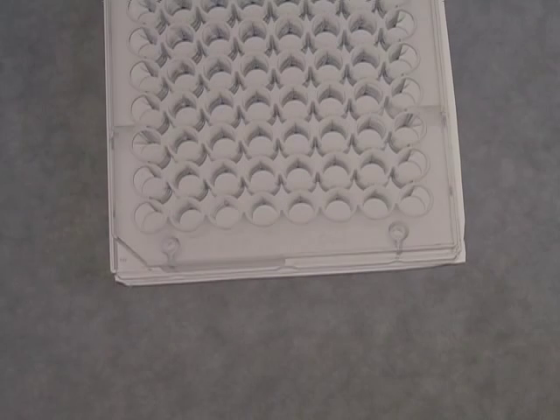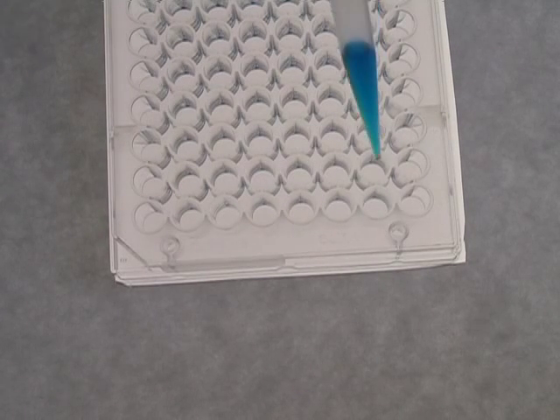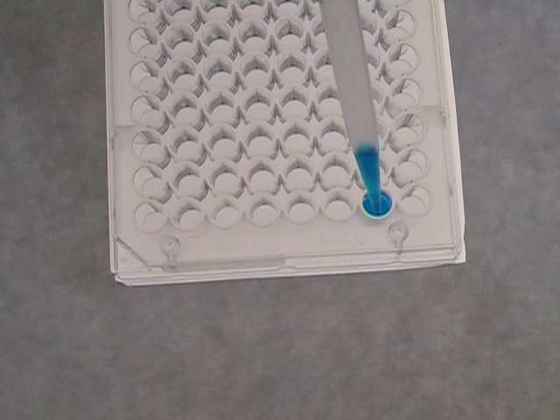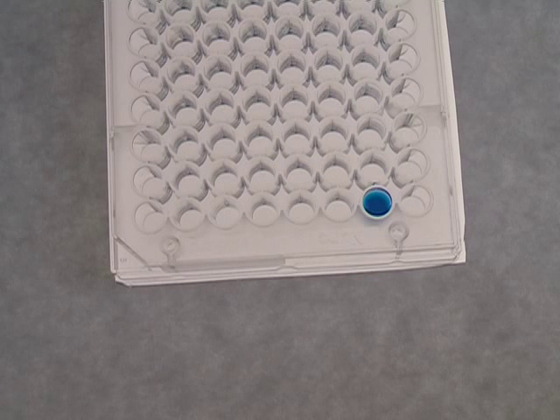Now for a demonstration of a serial dilution. Serial dilution is a set or series of dilutions where the dilution factor is kept at a constant. This technique is often used when testing various concentrations of a stock.